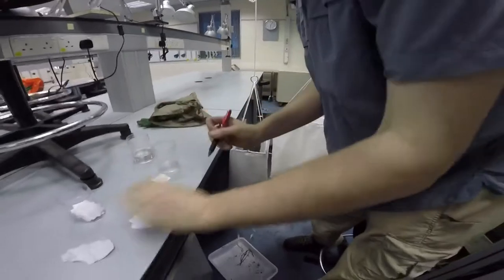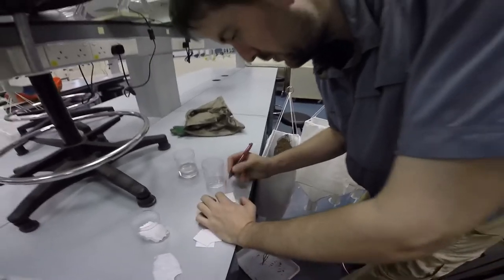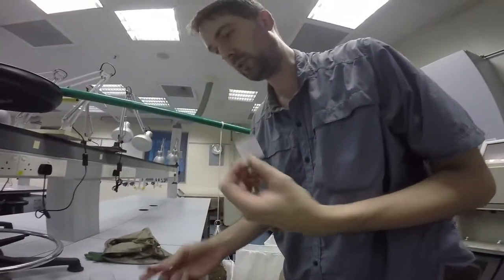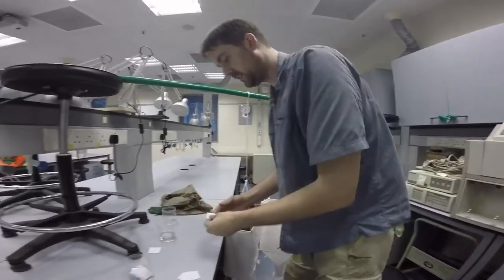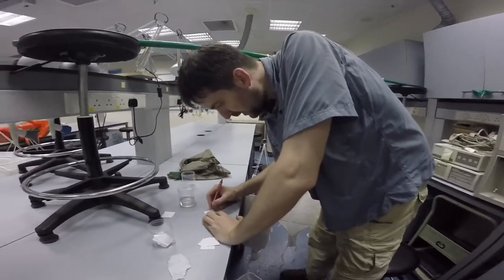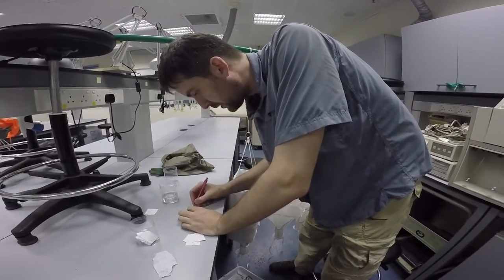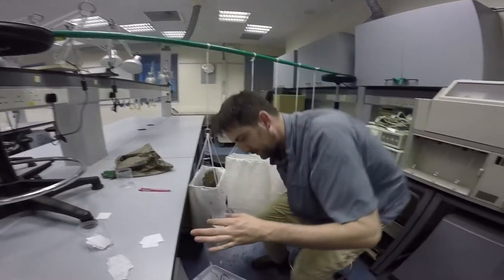Now make the tag — SMW2. That's actually a pen — I like a pencil. So that's a good example: do not use a pen because with ethanol, of course, it's going to fade and get diluted. So here's a pencil — perfect. SMW2. I'm going to write both sides just to be sure — SMW2. Then we put it in the cup; it's going to fall in the bottom flat. Perfect.